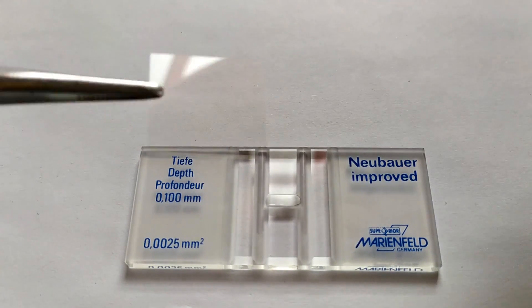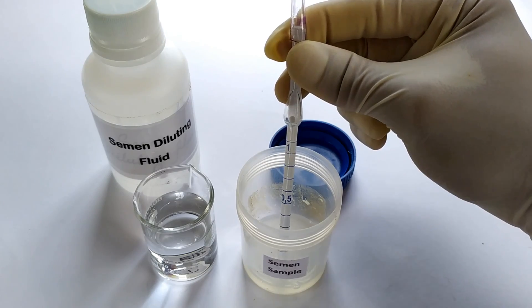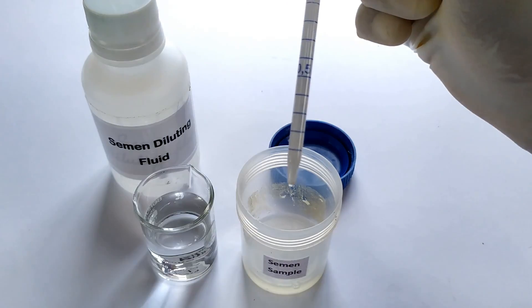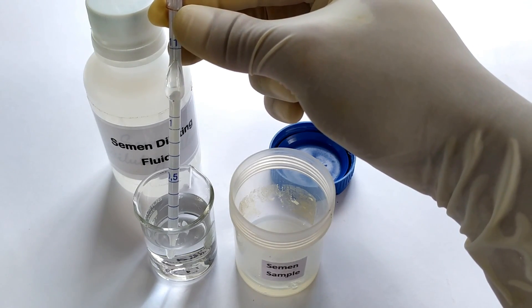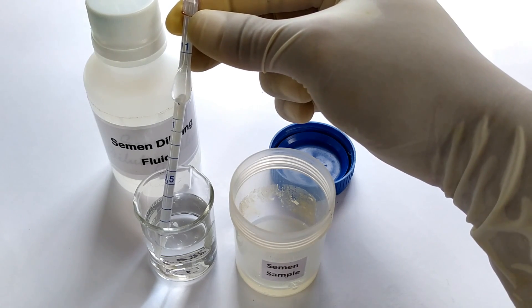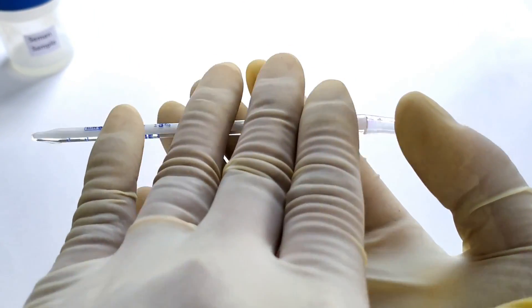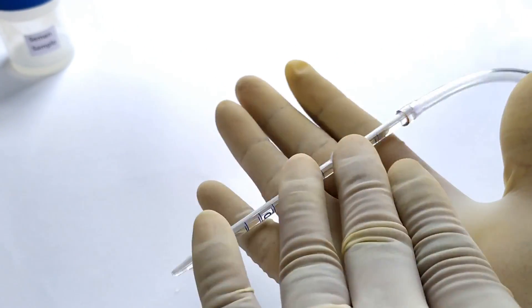First, prepare the counting chamber by placing the cover slip in position and keep this aside. Now draw a liquefied semen sample till the 0.5 mark of the WBC pipette, then draw the semen diluting solution until the 11 mark on the pipette. Gently wipe off excess fluid from the sides of the pipette tip. Now place the loaded pipette in a horizontal position and gently mix the contents for a minute or so by rotating the pipette between the palms of the hands.